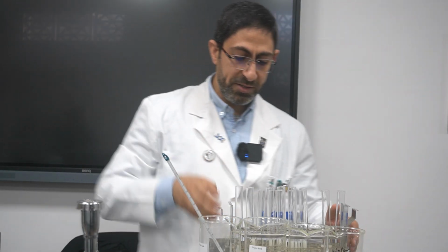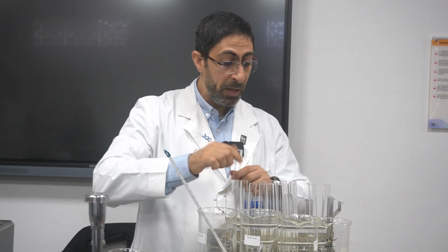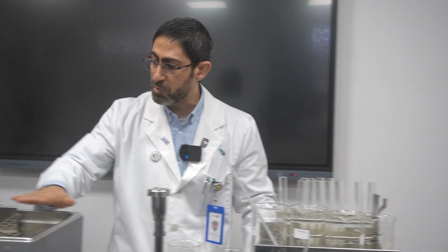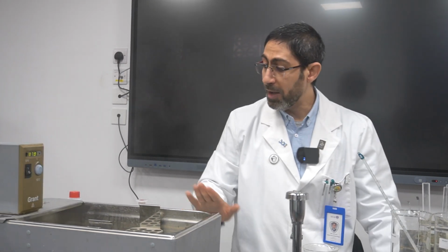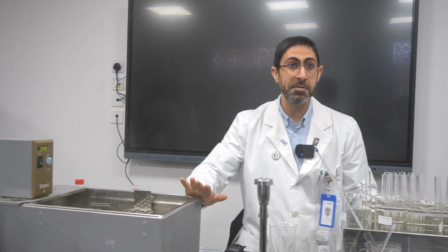Now I will do the rest of the different temperatures. In order to do so, I may use the thermostatically controlled water bath, starting from 20 and raising it up to 30, 40, 50, 60, 70 and 100. But as I told you, it takes a lot of time, and I have a class in less than 10 minutes.